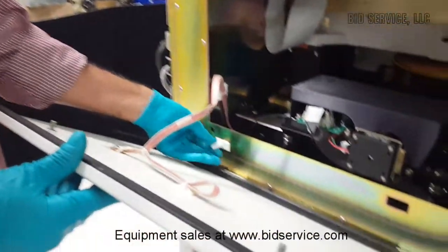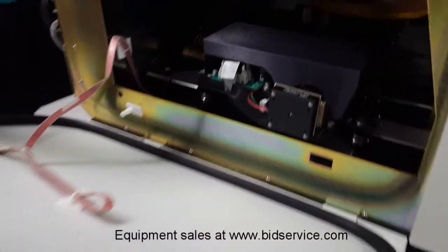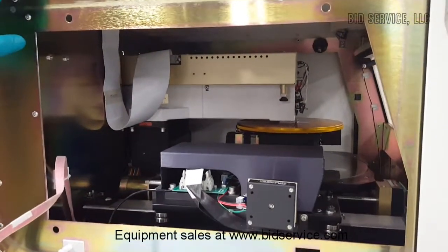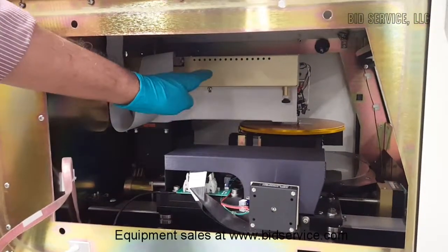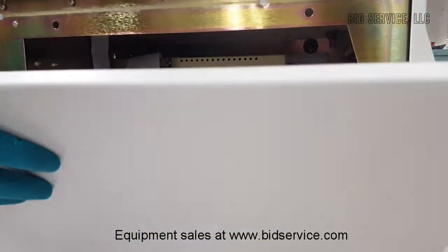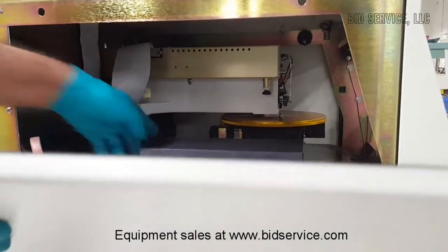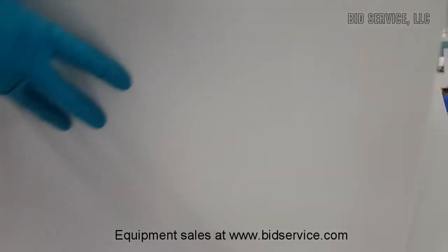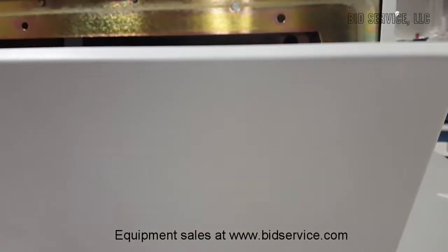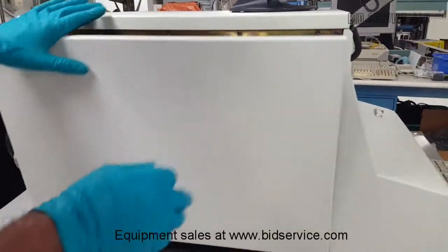So there are door interlocks here, and this is the inside view of the tower. But when we ship it, the tower will not be that close to the table, and the proper brackets have to be removed. There will be a turnbuckle clamp here, and for the stylus there will be a clamping mechanism to avoid any kind of vibrations during shipping.